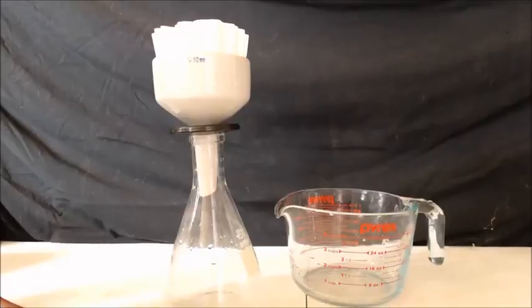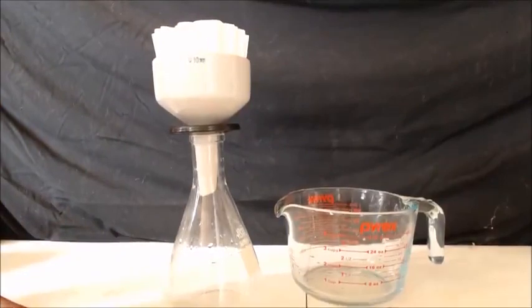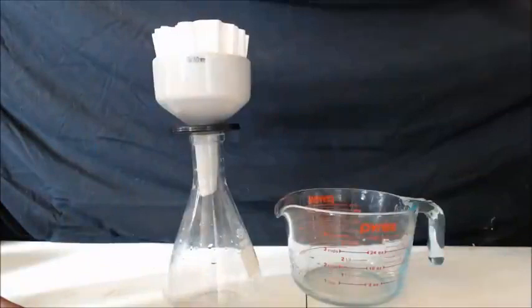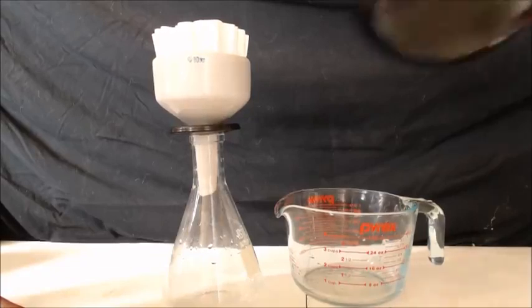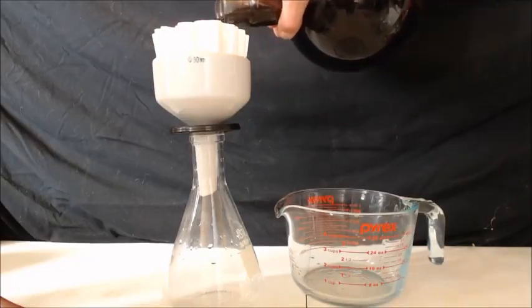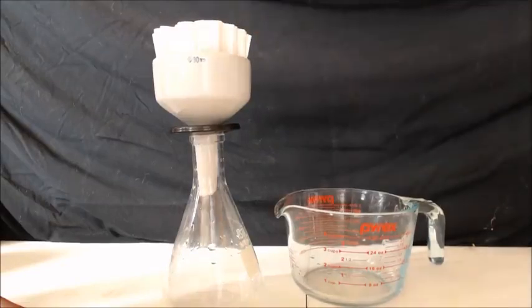I'm going to stop the dripping for now. I lost the reflux footage, but I did reflux it for about an hour. You can't see it well on camera, but there is a clear top layer, which shows the reaction is probably done. This is also a good way to make MnO2 as a byproduct. After filtering, it comes out crystal clear — that indicates a completed reaction.